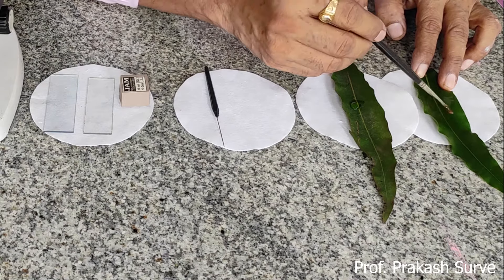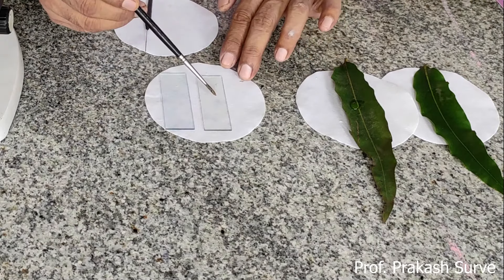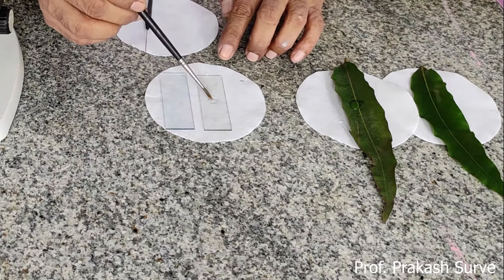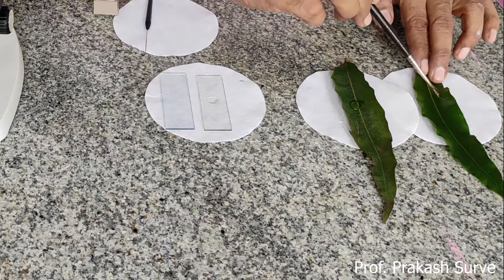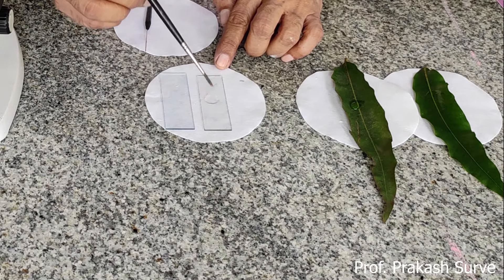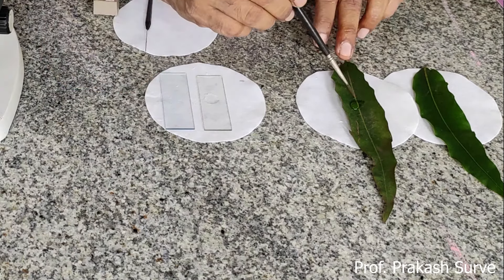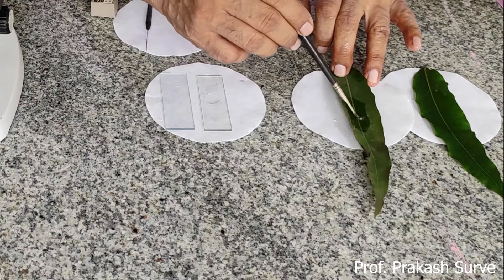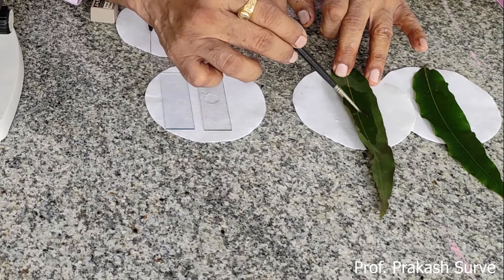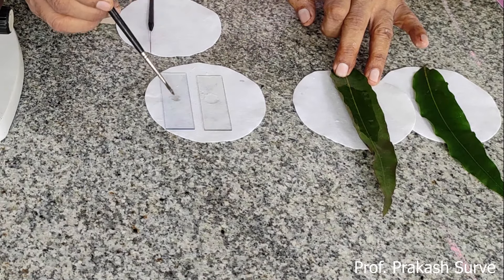Whatever particles are present on the washed leaf will stick to the glycerin, and then we transfer the glycerin onto a clean glass slide, placing it at the center to collect the maximum glycerin from the washed leaf. Next, we clean the brush thoroughly, and then use the clean brush for the unwashed leaf — spreading the glycerin throughout its surface and transferring it onto the other clean slide.